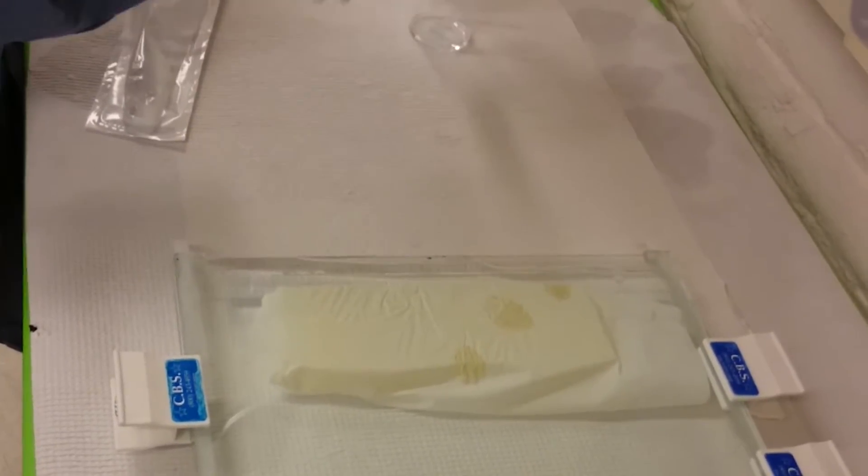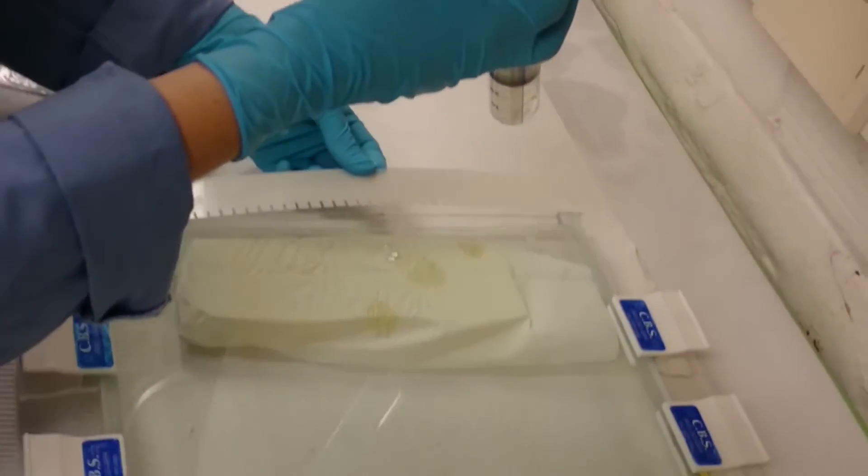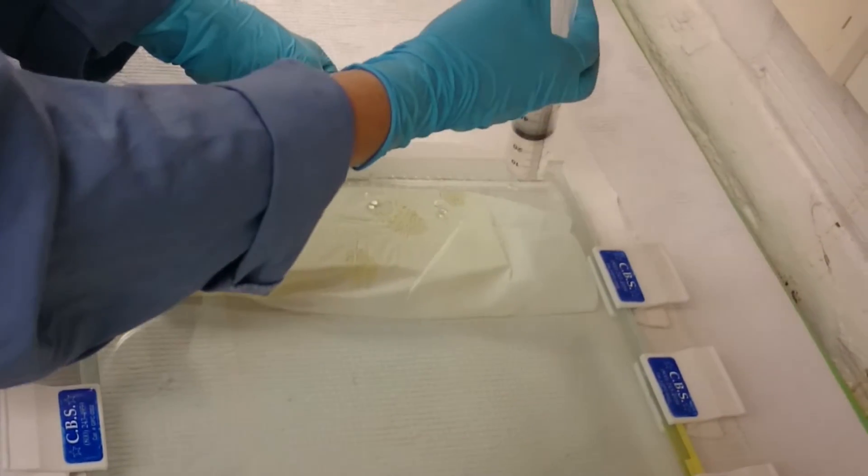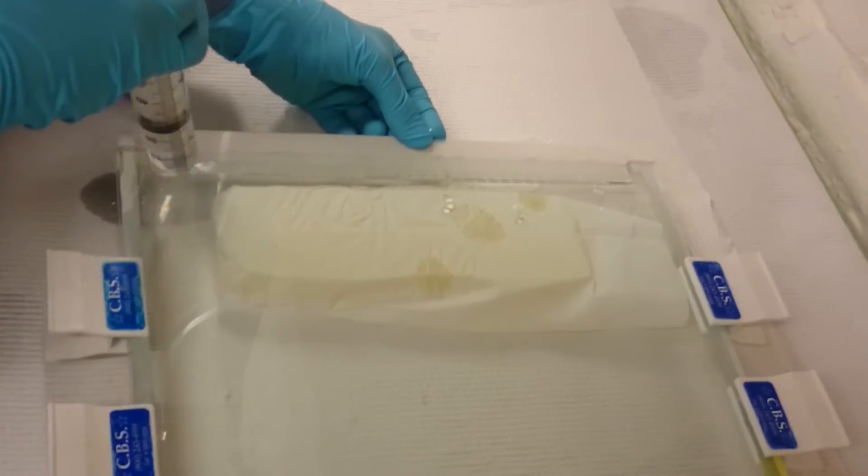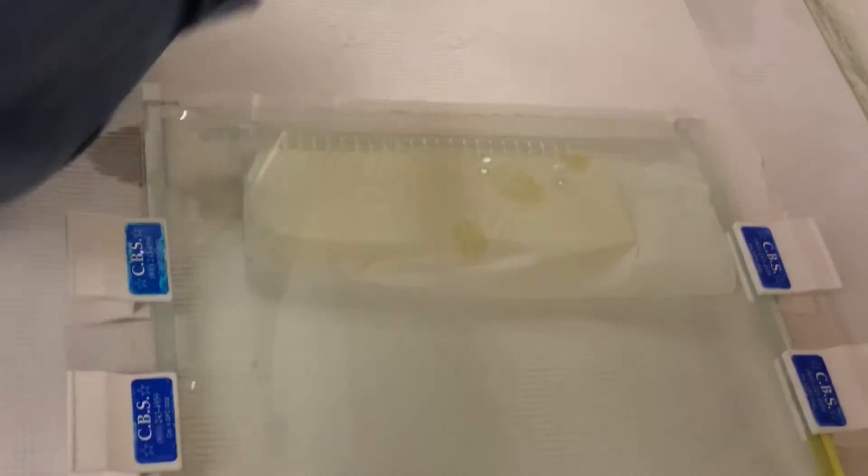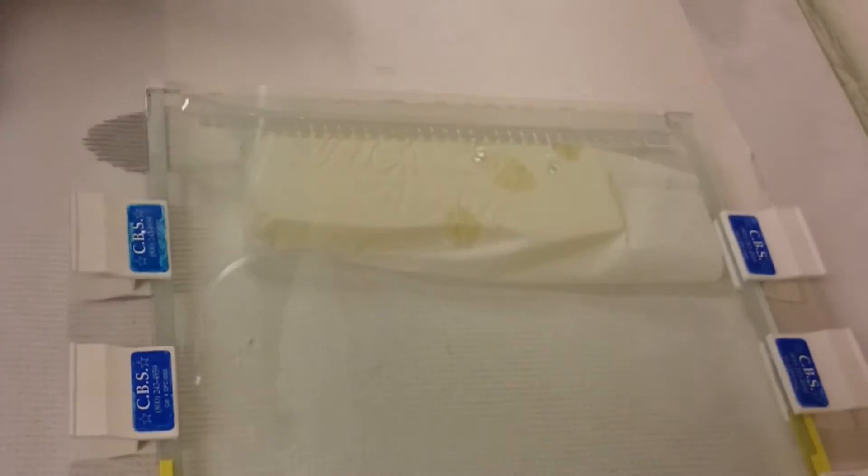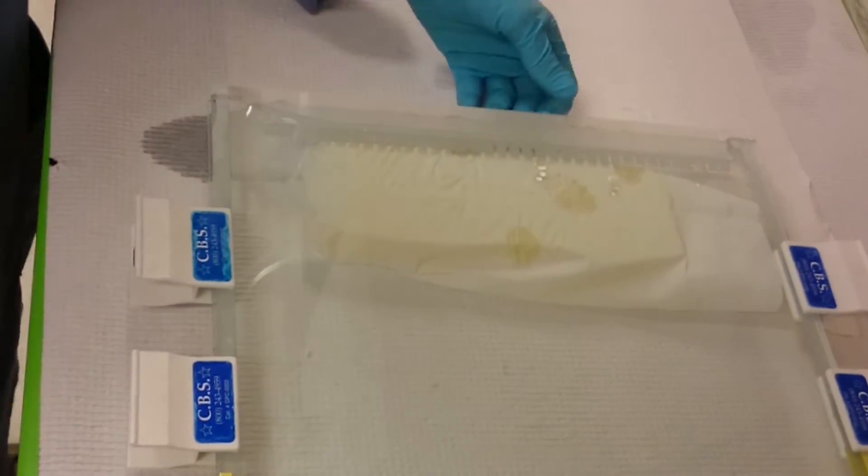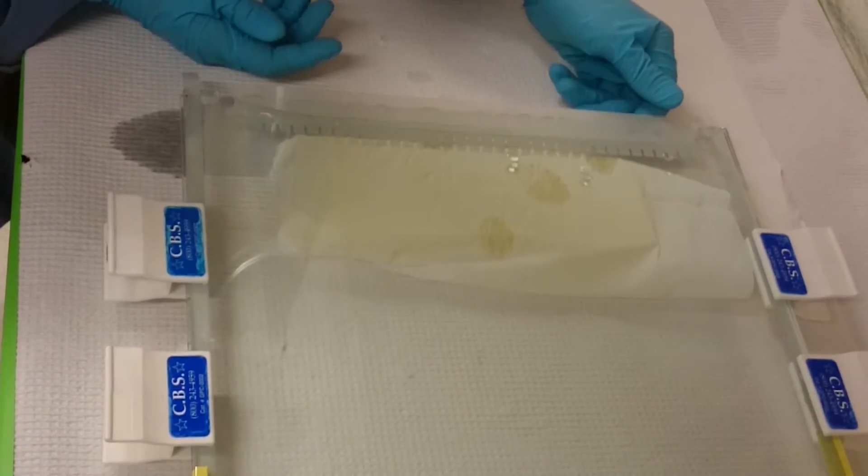And then unlike with a thicker gel where you can just stick the comb right in, it's a good idea to lay it in the gel and then cover it with more liquid and then slide it in. If you don't do the additional covering step, the air that's in between the combs at the beginning can end up inside the gel.